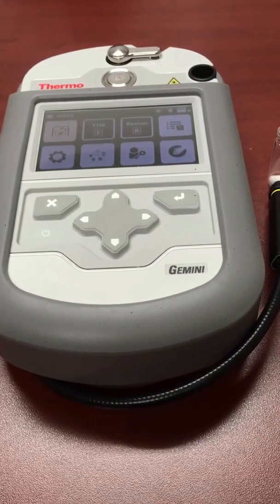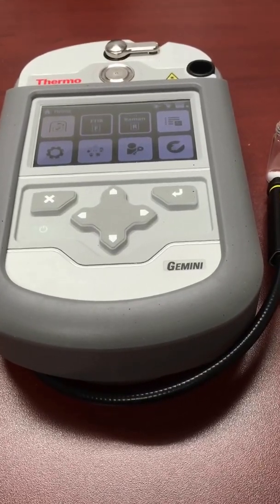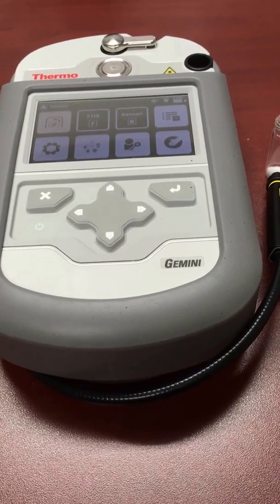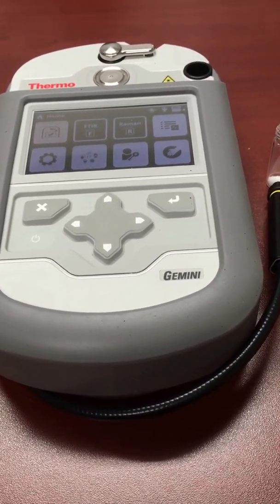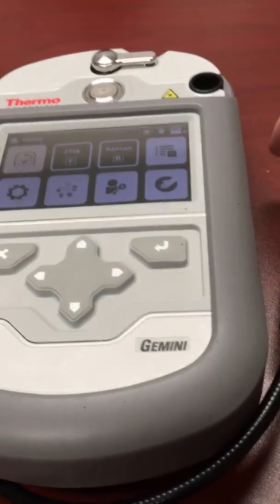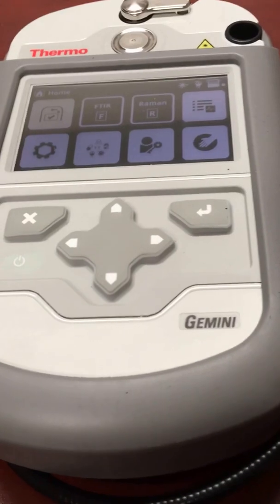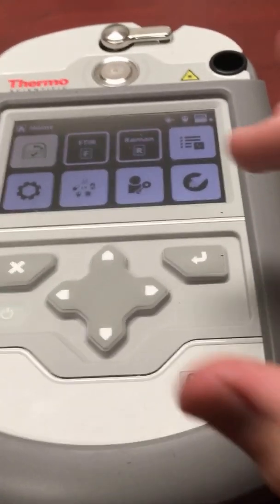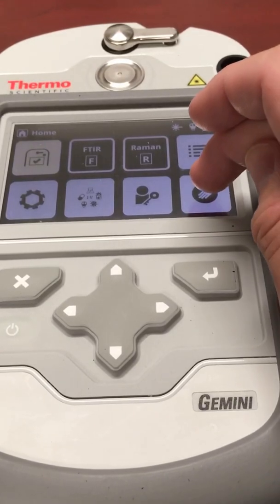This is a short video on the Thermo-Gemini Raman and FTIR unit, which is used to identify unknown chemicals and explosives. We have an unknown chemical in a vial, and I'm going to walk through the process here.